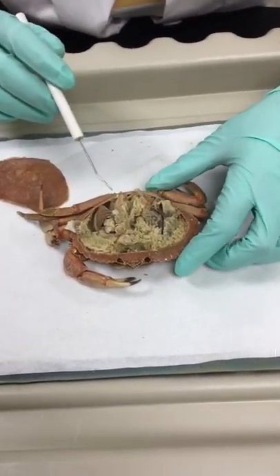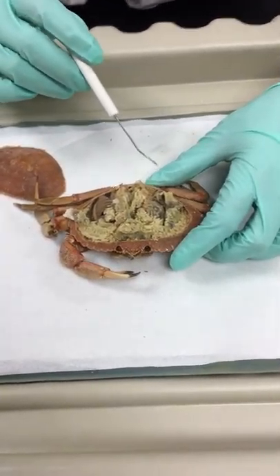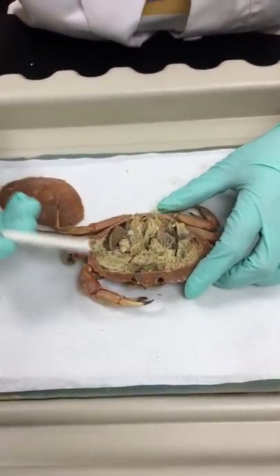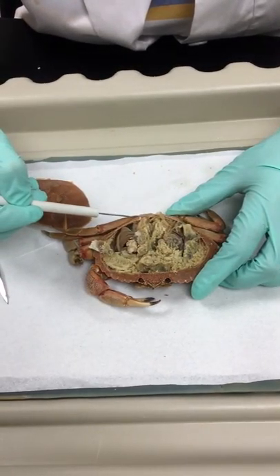What we're looking at is the internal anatomy of the crab. Anterior, posterior.